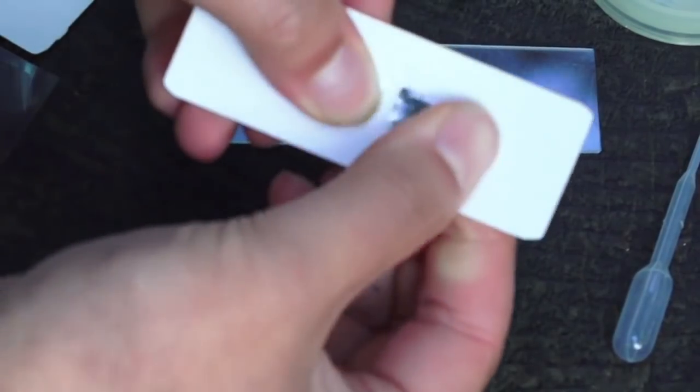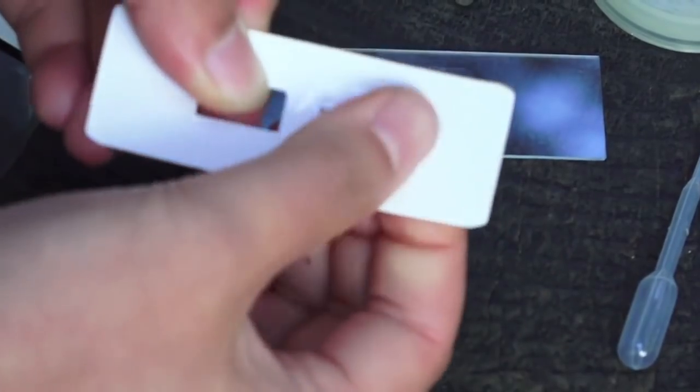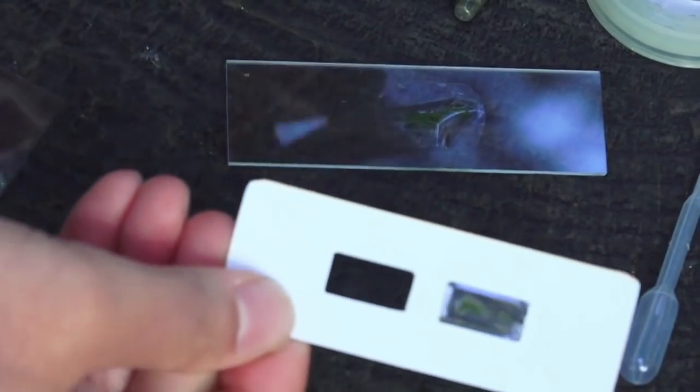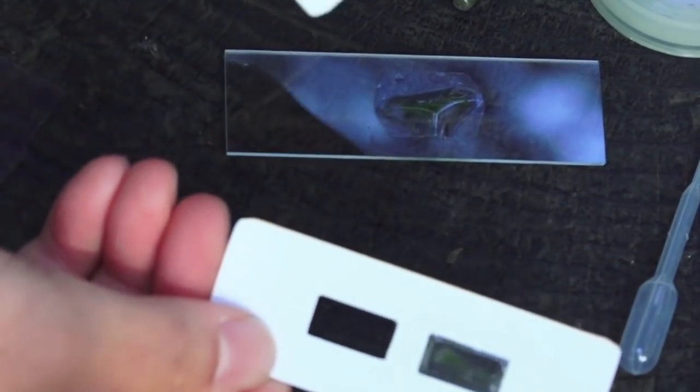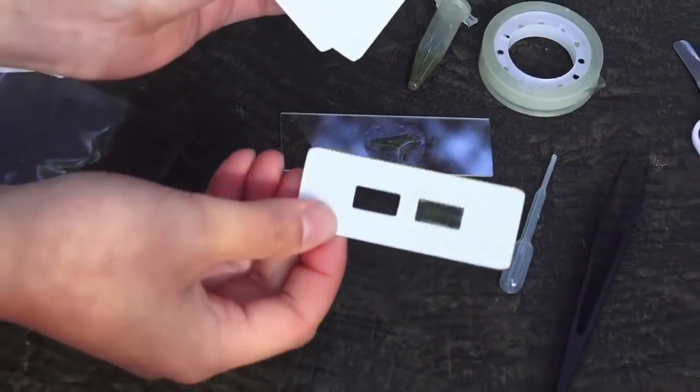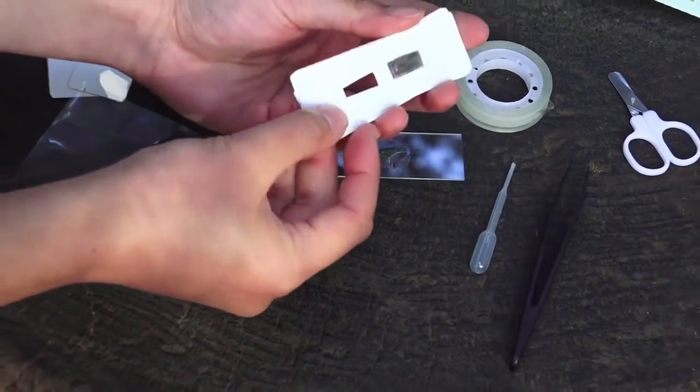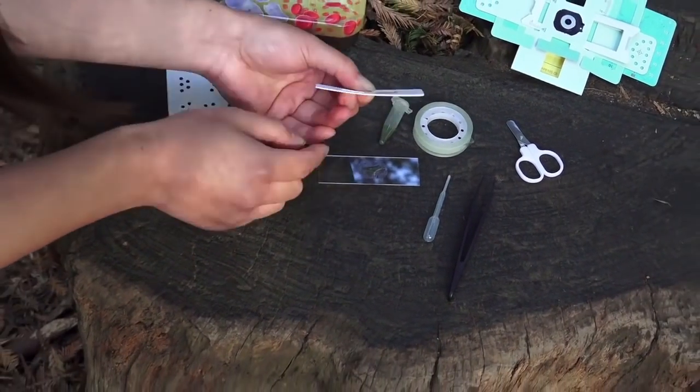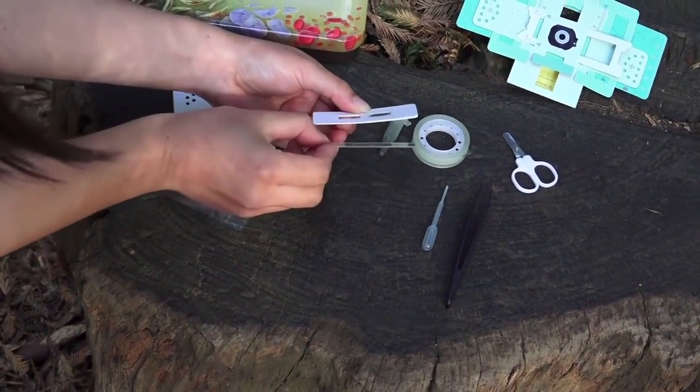It's okay if something spills out, you can wipe it away. If you're using paper slides, make sure that you put two blank paper slides underneath so that the thickness is just like the glass slide.